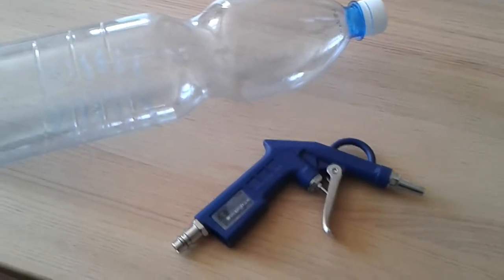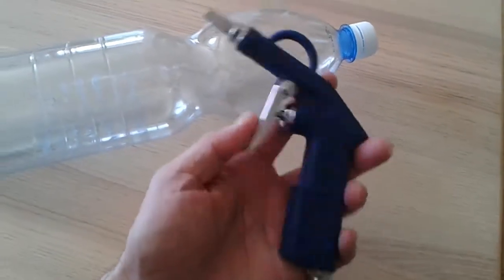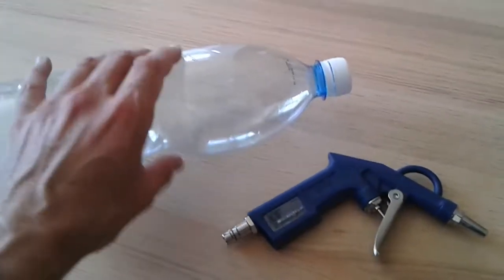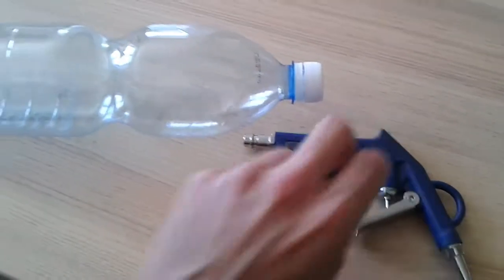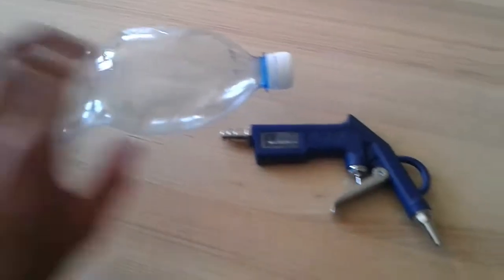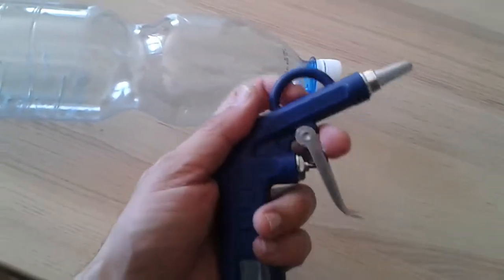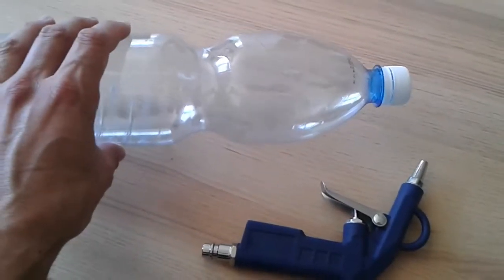So, I'm going to show you now how to make an air de-duster. I got this from a local hardware shop. I think it's called an air gun, and there's an air connection down here, and of course a plastic bottle. What I'm going to do is connect this air gun to the cap of the plastic bottle, and then I can pump up the plastic bottle with a bicycle pump. Then, at least that's the idea, I'm able to use the whole construction to de-dust my microscope and also my computer. I've not tried this yet, so I don't know whether it's going to work. I hope that the bottle is going to be strong enough to withstand the high pressure, but we'll see.